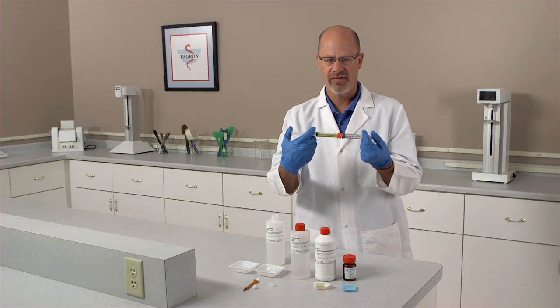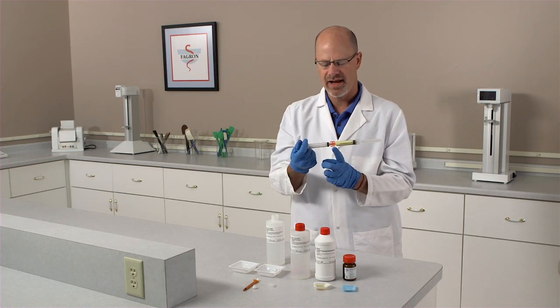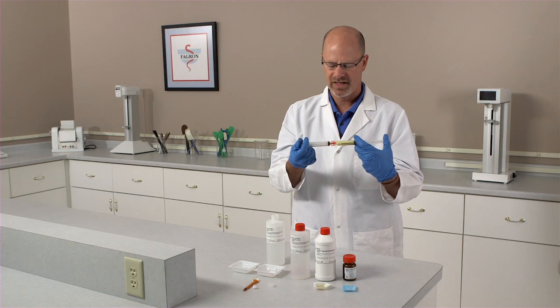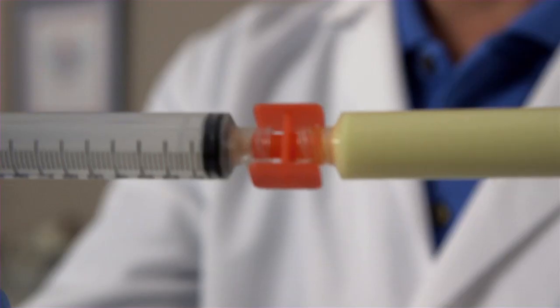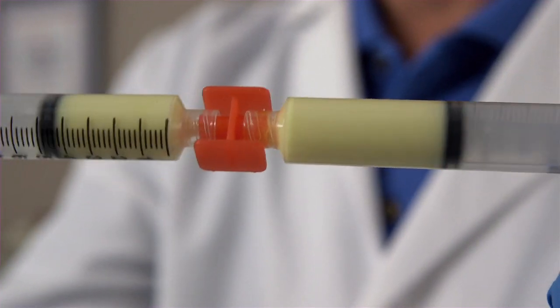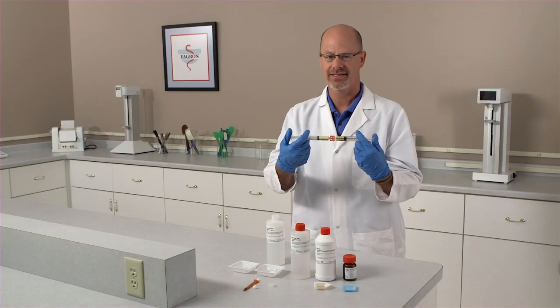And what we'll feel is resistance and that's due to shear and heat as this preparation goes through the luer lock to luer lock coupler. It's important to have a nice homogenous preparation when you're done with your mixing process.